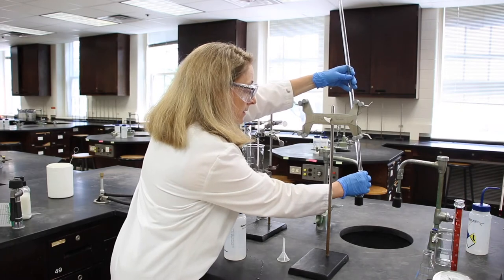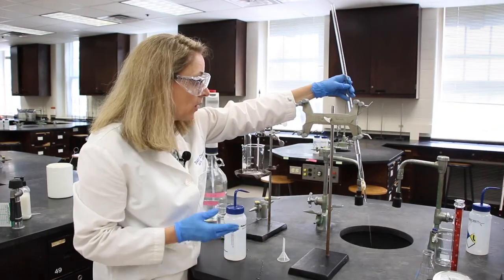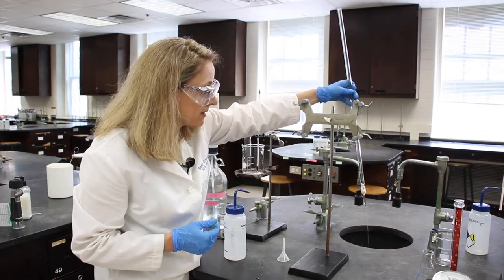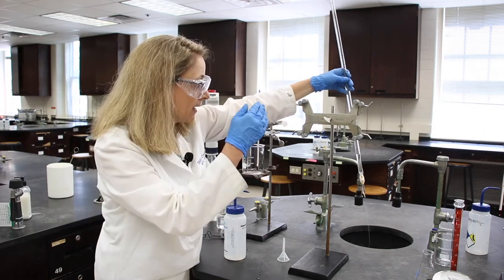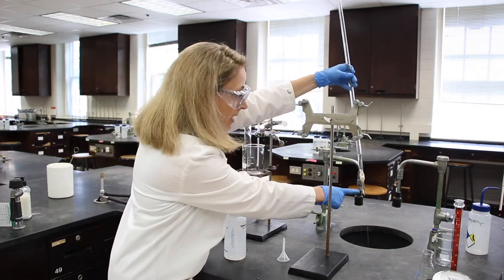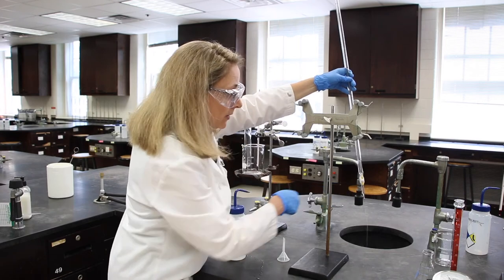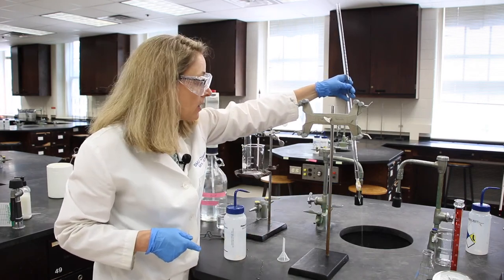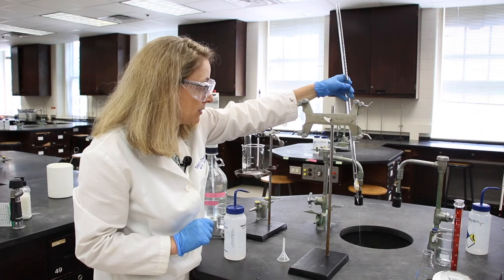When we're done, since this is just water I can put it to the drain, we'll open the stopcock and let everything flow through the stopcock and the tip of the burette so that those surfaces are coated with the solution that we'll be using too.